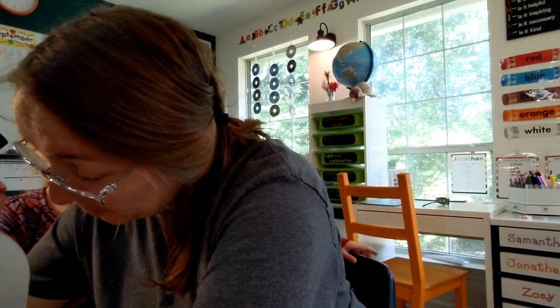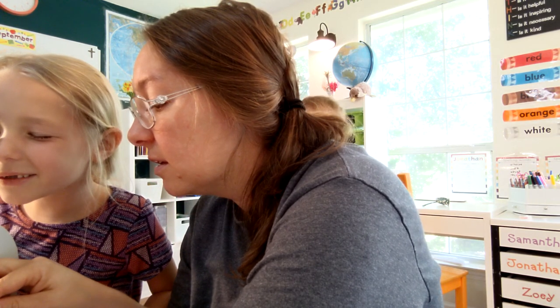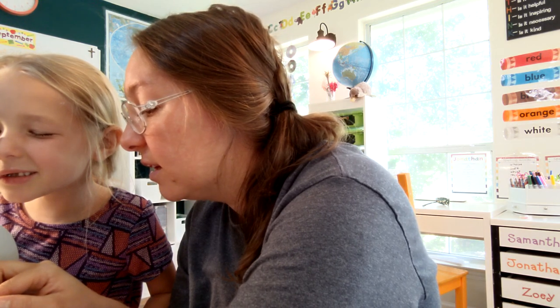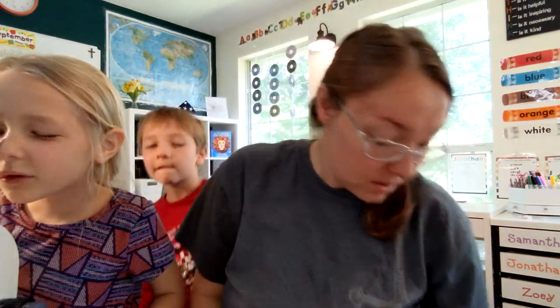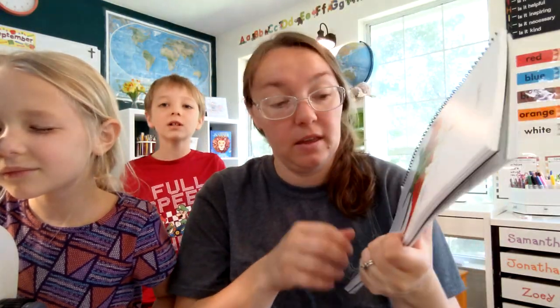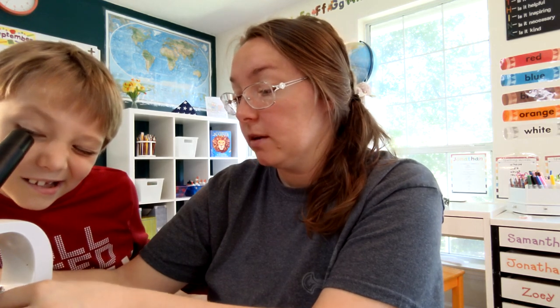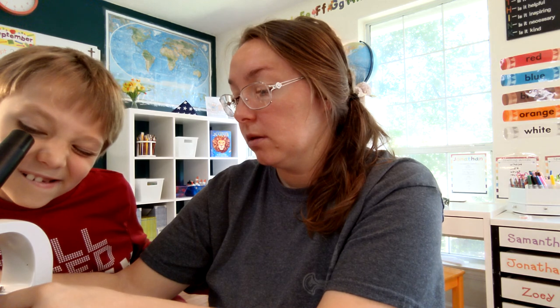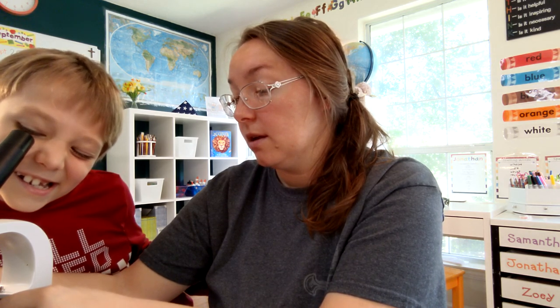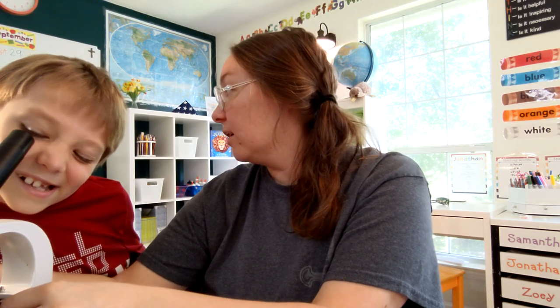Okay can I see? Ready? What do you see when I start to do this? Lines? You see the little hairs sticking off of it? What do we think those are called? Thorns? Does anyone remember the name? No? Okay, let's look at our parts of a flower — they're called filaments. So that's the filament. Can you see it? Yeah, ready, keep watching. You see the little hairs? Yeah! Isn't that cool? Very cool — wow, those are more cooler than bumble. Well, it's not a competition!